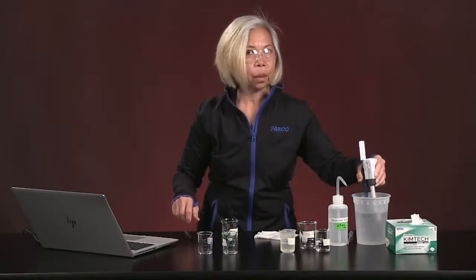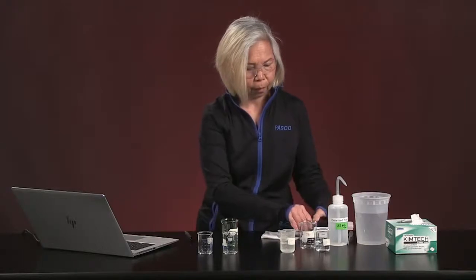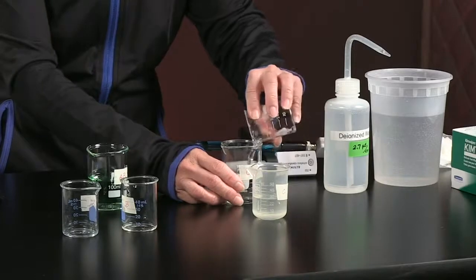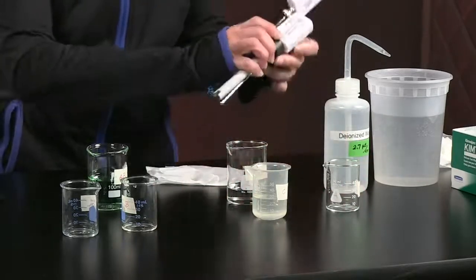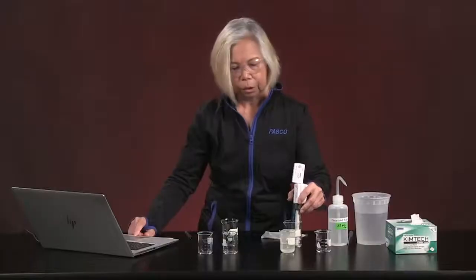Let's see what happens if we mix C and D. We're going to start this.